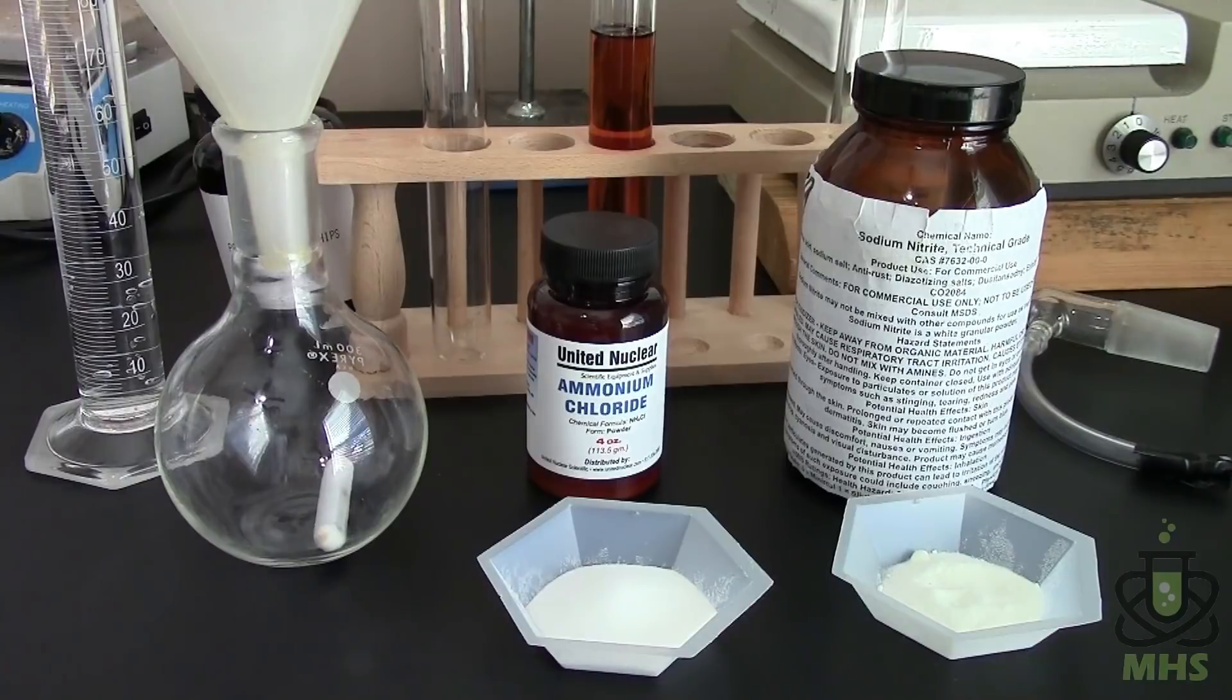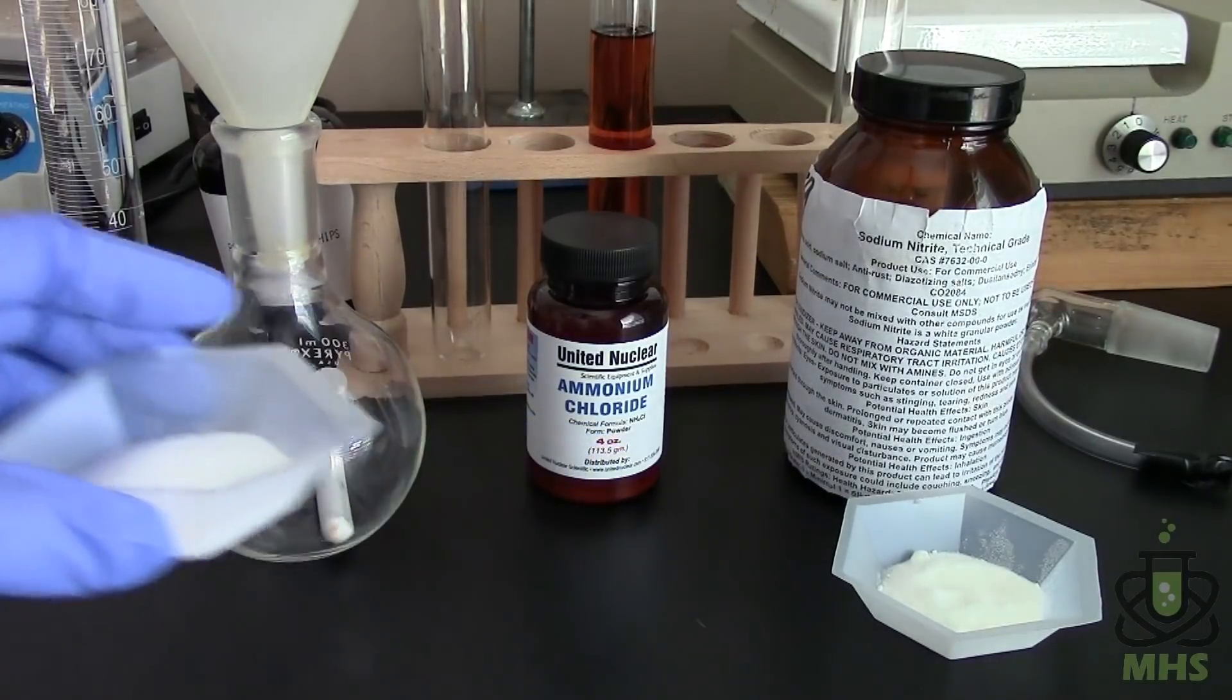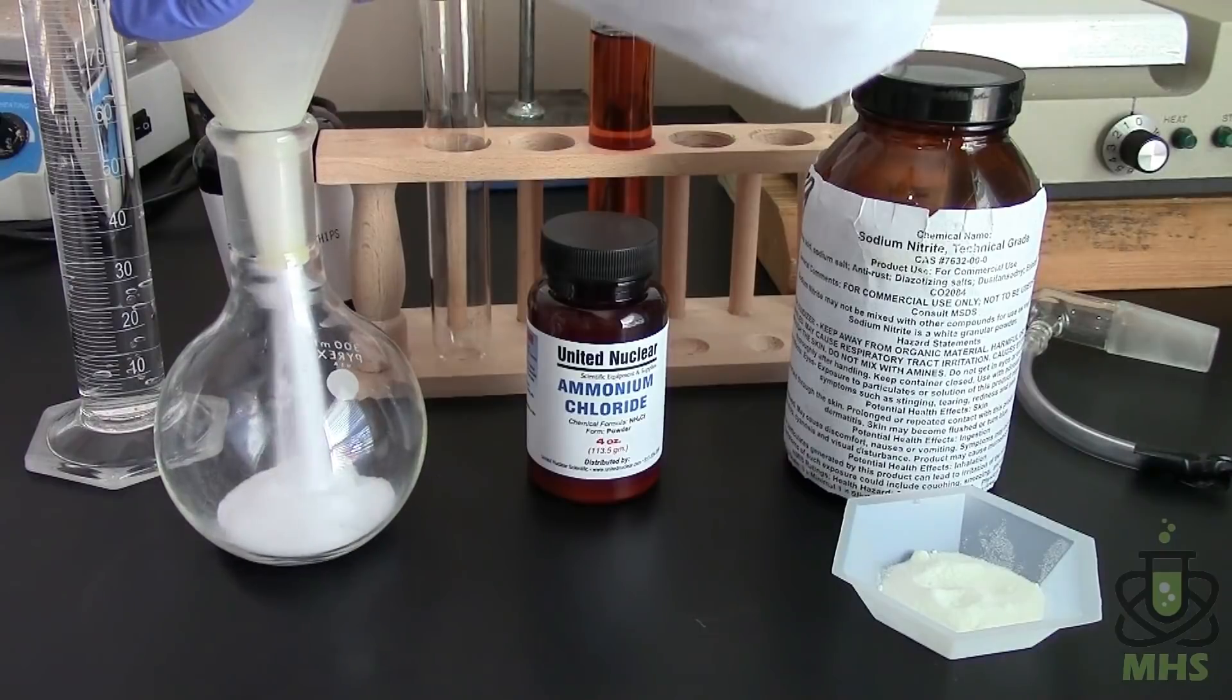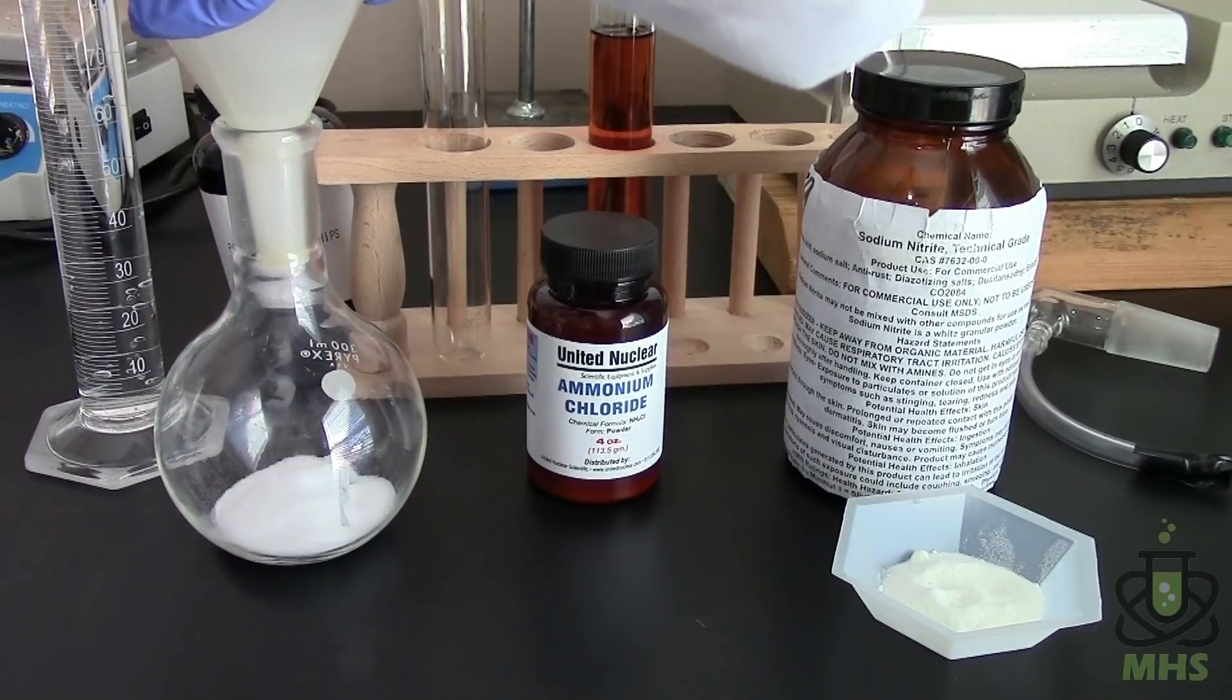Stoichiometrically this is about twice as much ammonium chloride as is required but I wanted to make sure that that's an excess because sodium nitrite is fairly toxic. I mean I know that it's a food additive but as a pure chemical it's not very friendly so we want to make sure that we get rid of it completely.